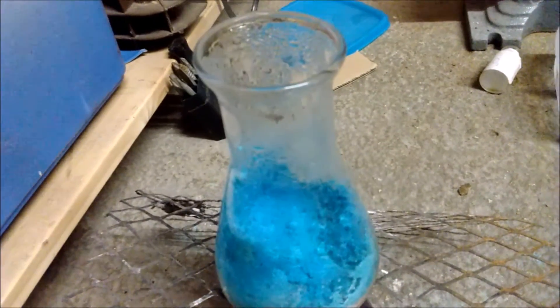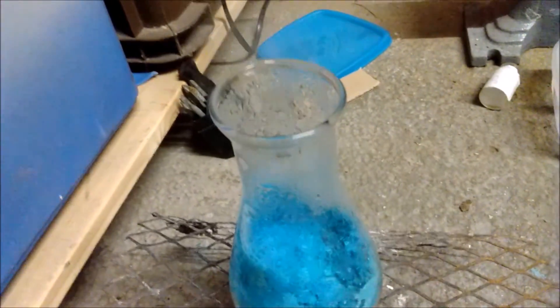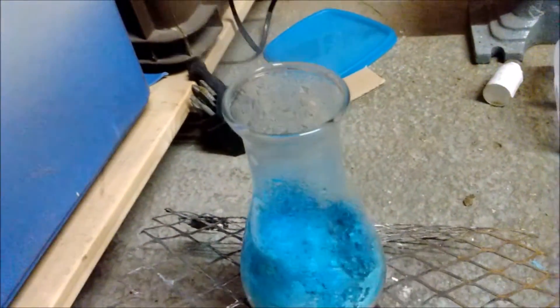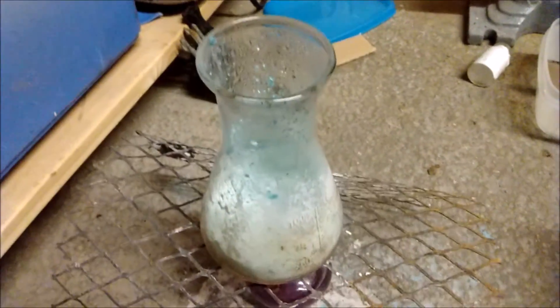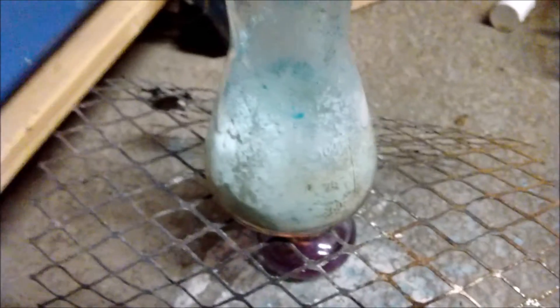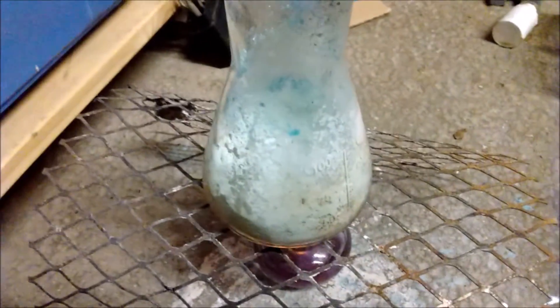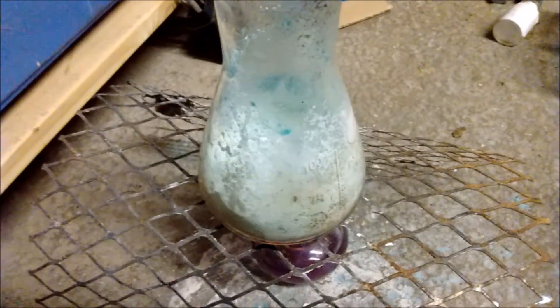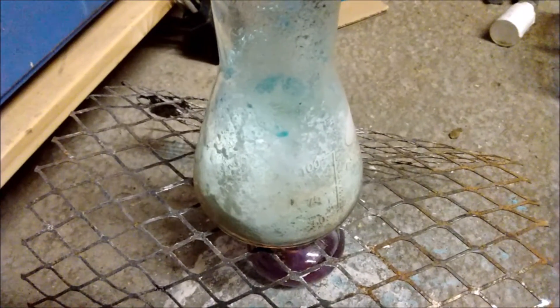But it is actually quite impressive, this might just be me being sad, but it's quite impressive that this amount of dry crystals, or seemingly dry crystals, contains this much water. So, most of the steam has stopped now, and most of it's gone completely white. There's still a few bits of blue that have been condensing on the inside. I'm not going to try and get it any further, because this should work well enough that you don't need it completely anhydrous.